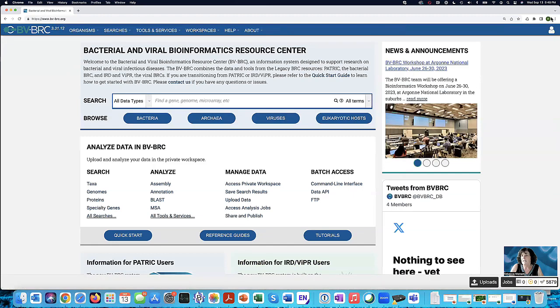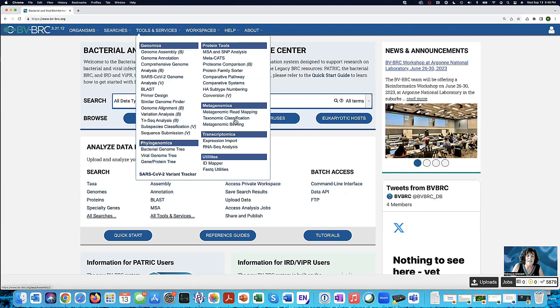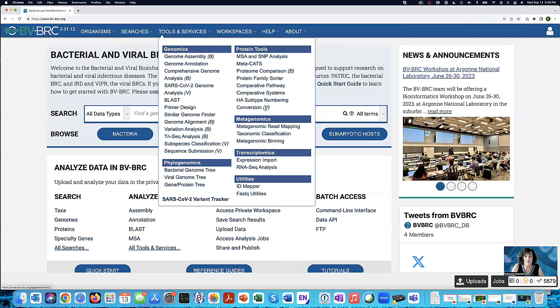And then when I'm signed in, I've got the little avatar here, and you can see I use this resource a lot because I can't do any coding. I have to do everything here. And I've got almost 6,000 jobs here. So up here are the tools and services, and these are all the things that you can do at this resource. And we're going to step through a few of them while we're going over this series.